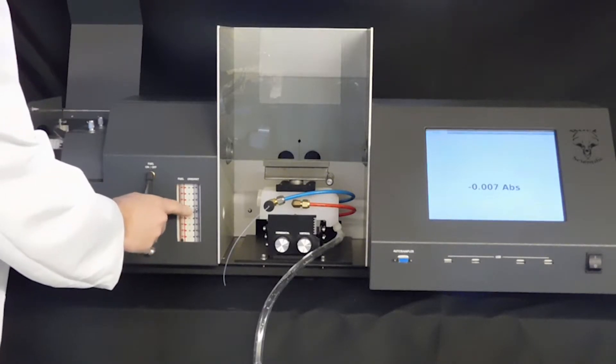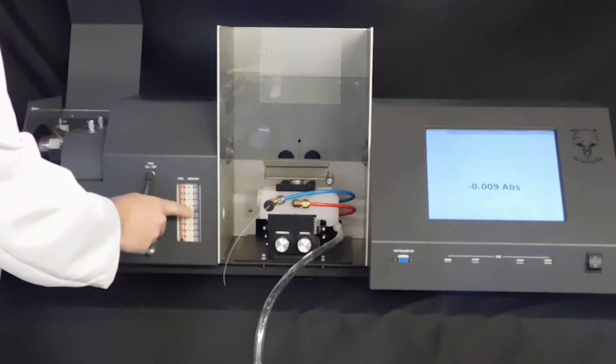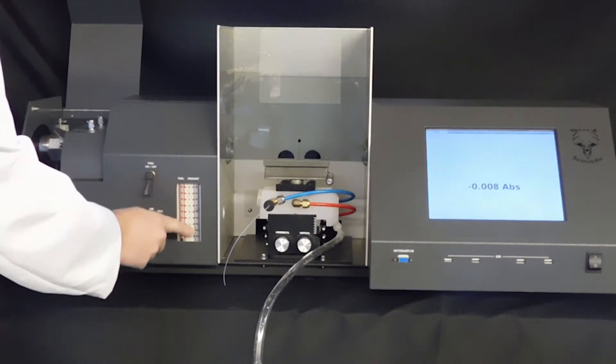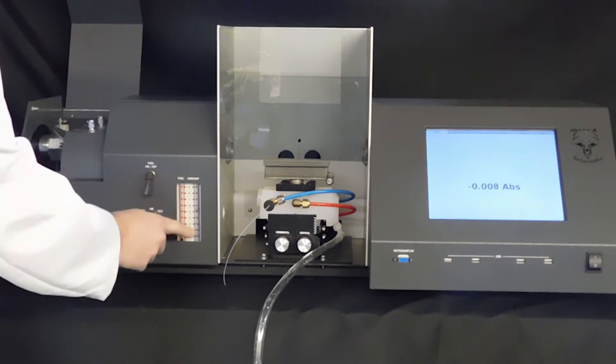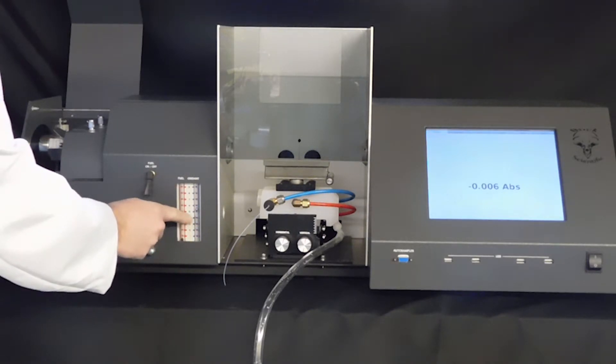Make sure that the ball indicator on the right side of your flow meter is between four and a half and six.